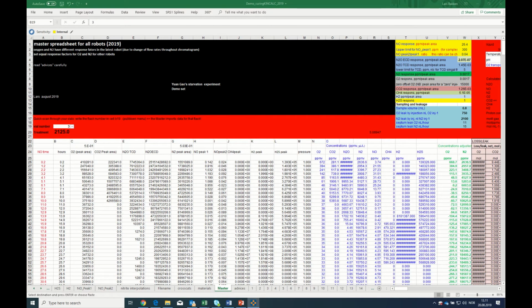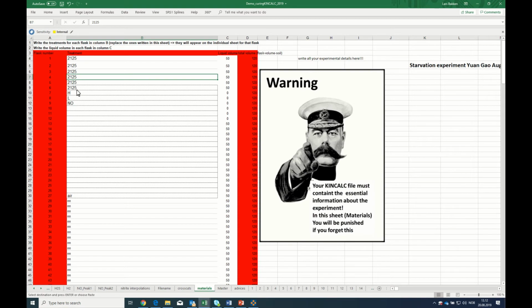My example in this case is an experiment conducted by Yuan Gao in our laboratory, and it's a starvation experiment, and it's a demo set. I fiddled with it slightly just to illustrate what might happen when you do an experiment and how you fix the problems. This is an experiment with 6 replicate vials with a starved bradyrhizobium, inspecting how it handles nitrite and N2O and nitrate under starvation conditions.